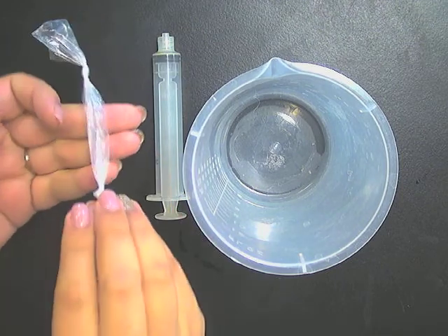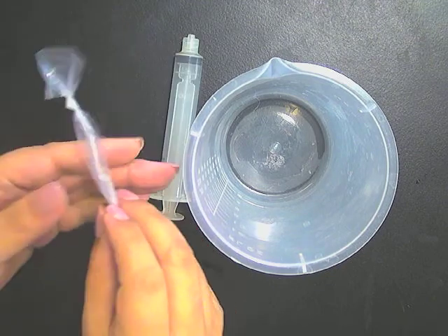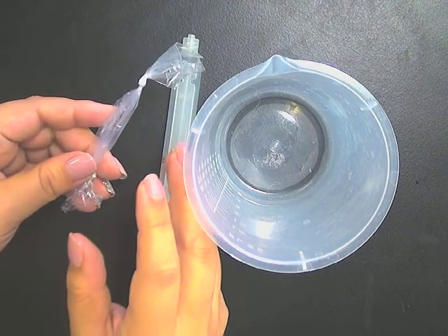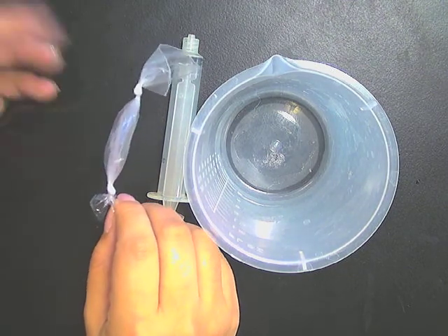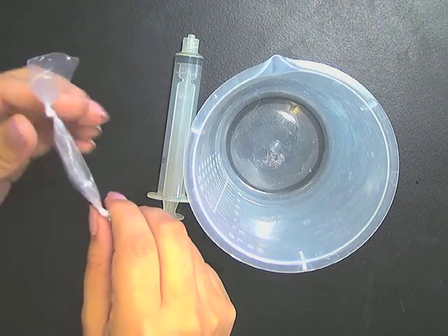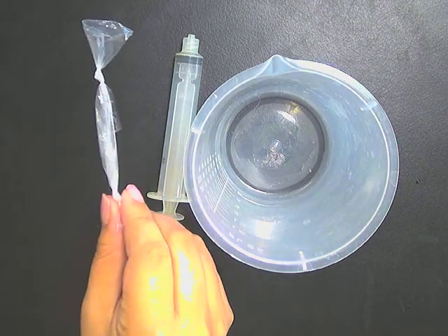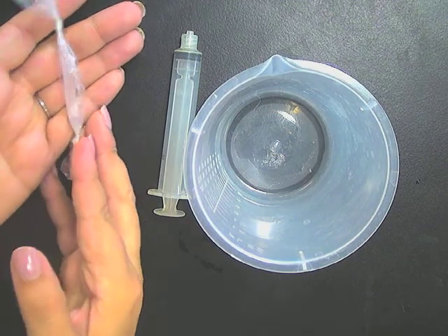Now you don't know which one the water is. It's going to be one of the colored solutions. But you'll know it's the control because when you take the final mass and calculate the percent change, you won't see very much of a percent change. Hopefully it'll be right at zero. But remember, this is a net process, so some water may be entering or leaving slightly faster at any given moment. You'll take your solution sausage, dry it off after soaking it, and then we'll record the final mass and calculate that percent change.